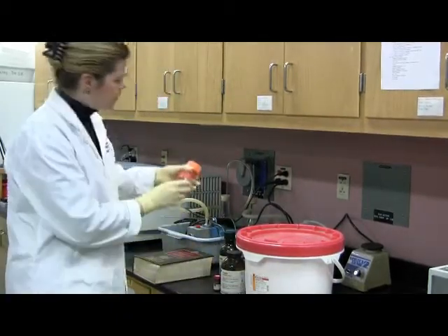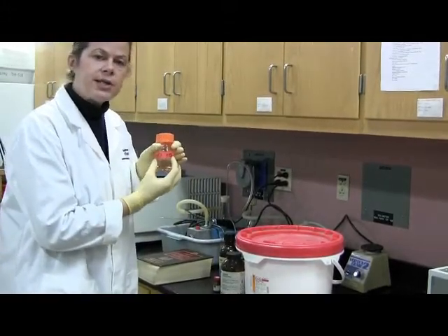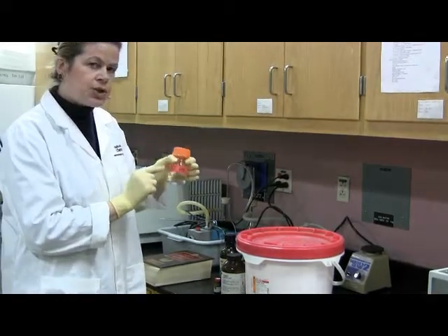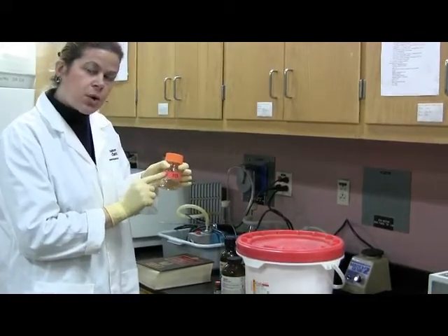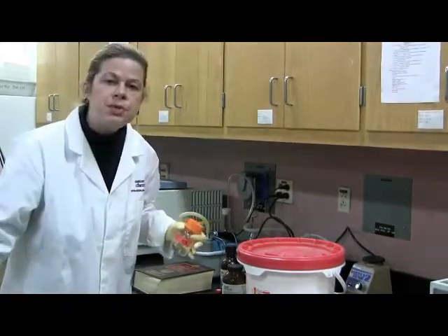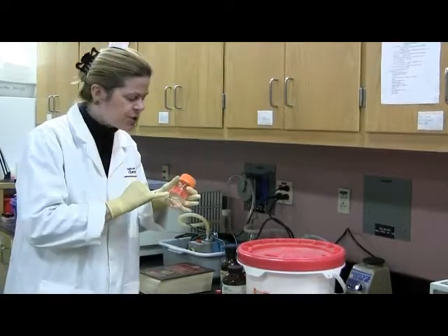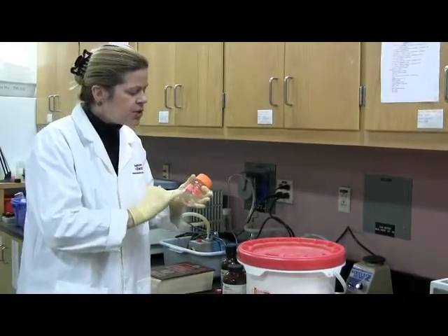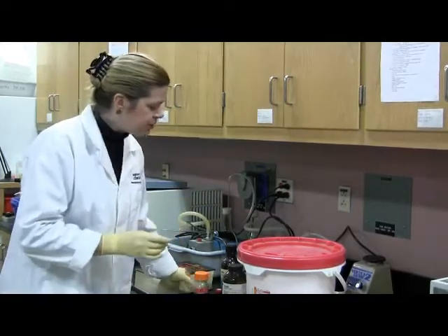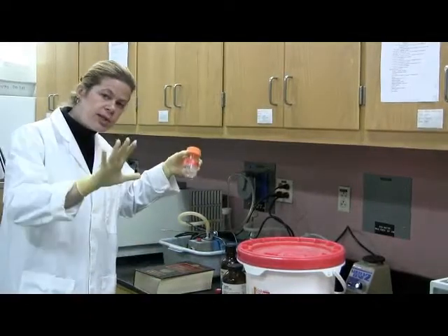How do we pH it? With hydrochloric acid. This is 37% hydrochloric acid. That's very concentrated. So you would do well to dilute this a little bit before you mix it into, try to make your tris base with it, because you may overshoot the pH. It's hard to get it right on, spot on, with a very high concentration of HCl. So you want to use a slightly lower concentration of HCl to prepare your tris buffer. All right, again, gloves, because this is dangerous.